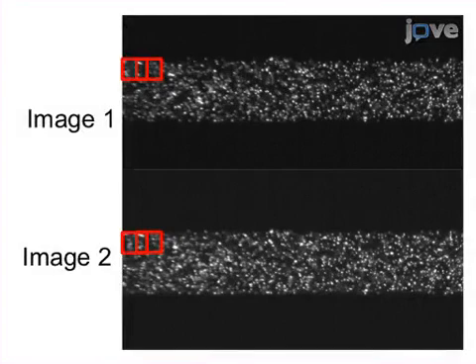Next, the blood flow is imaged at the desired planes in the channel using pairs of images from a pulsed camera or video from a high-speed camera.